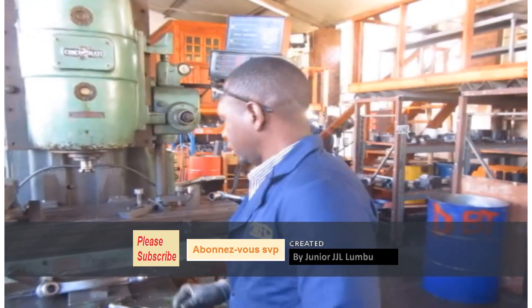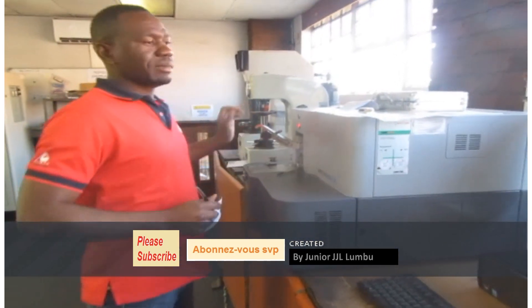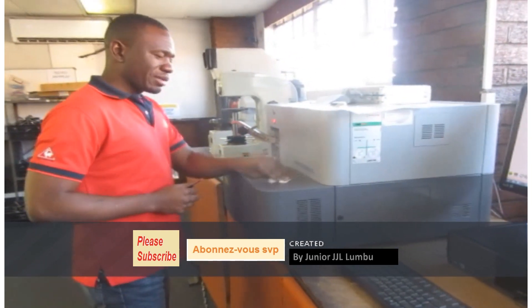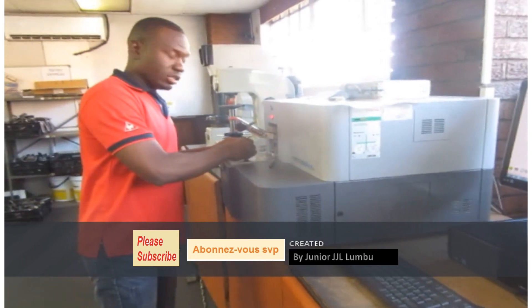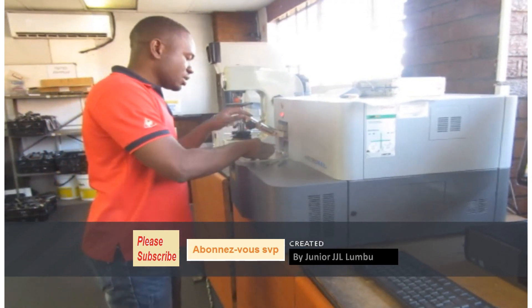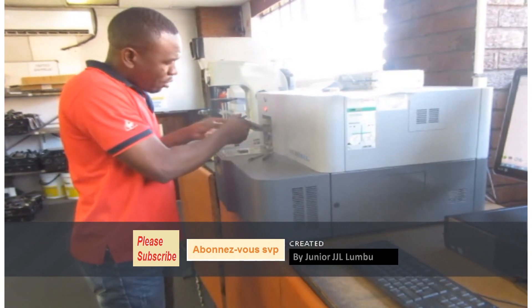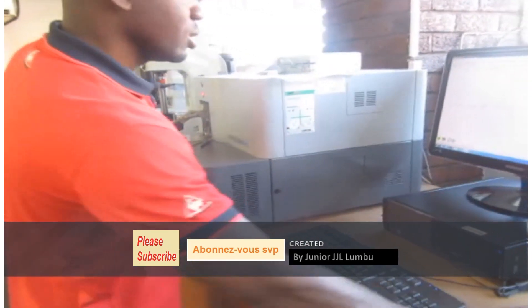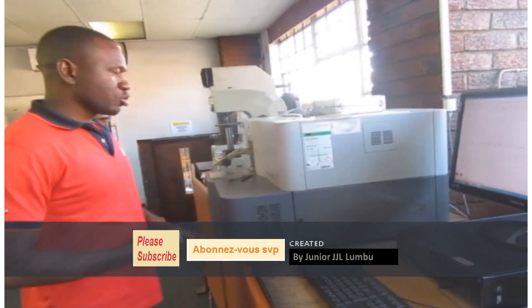This machine here works based on optical emission. The optical emission is sent through the sample by electrical energy, and that electrical energy transforms into a spark.